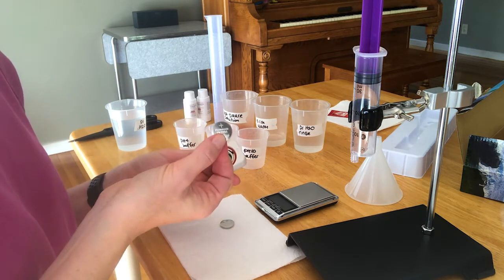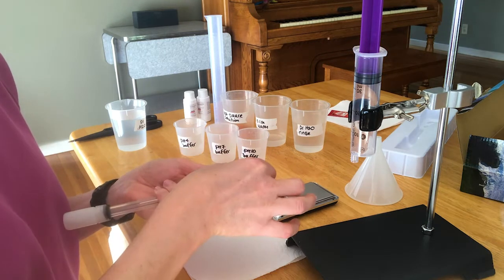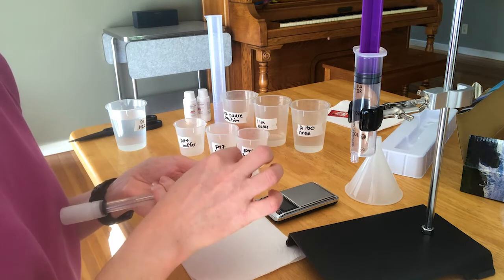So you have two batteries. You'll notice one side is flat and has a plus sign on it. That's going to go face up, same thing with the other one.